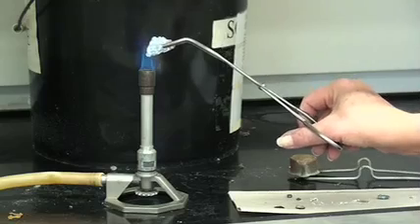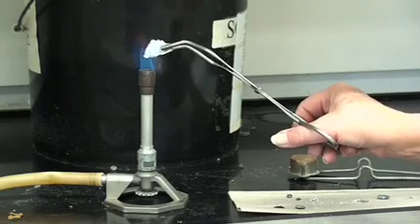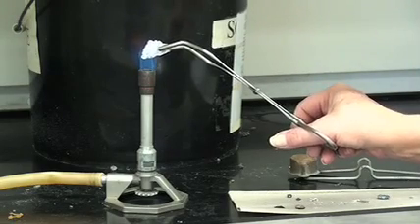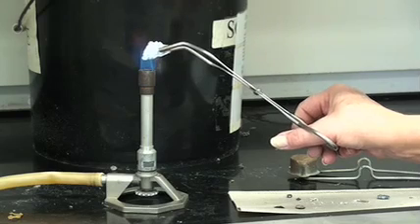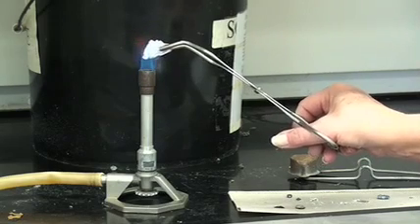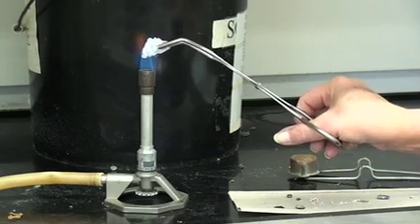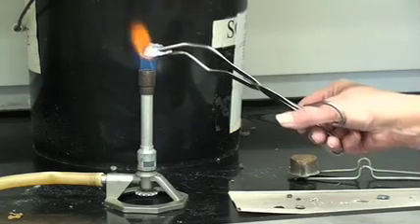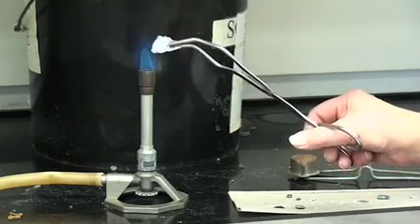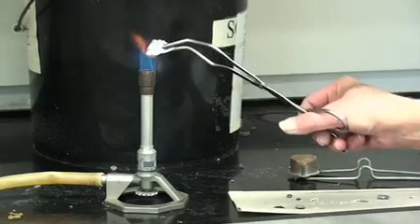Keeping in mind that we're not so much looking for a flame or the big flash, we're looking for the formation of a white oxide coating on this surface.